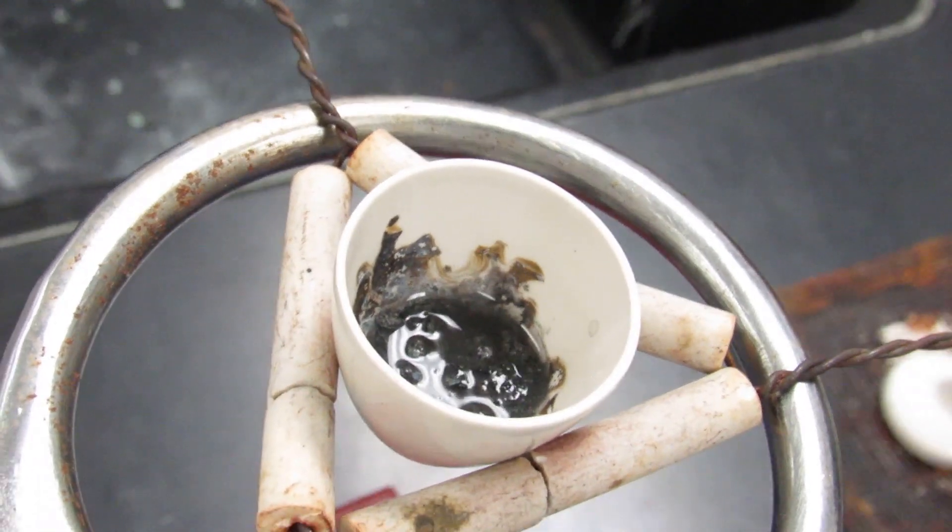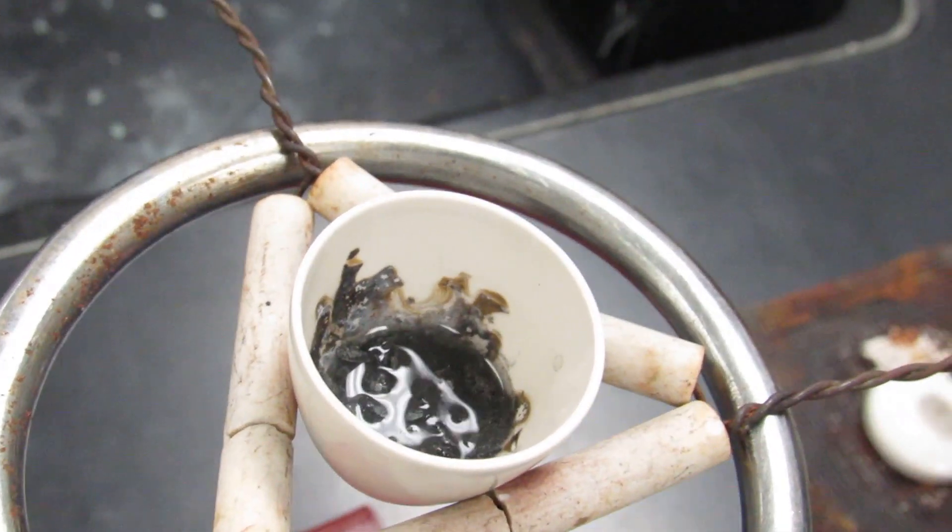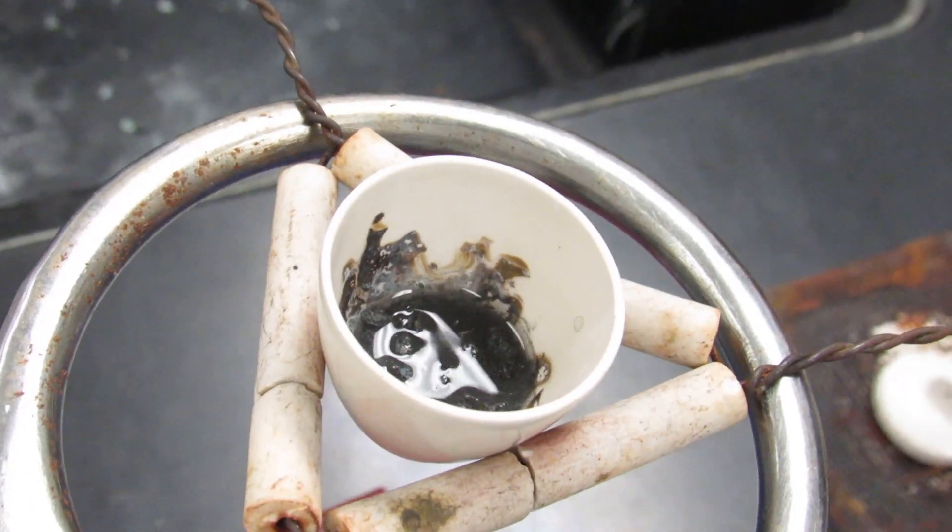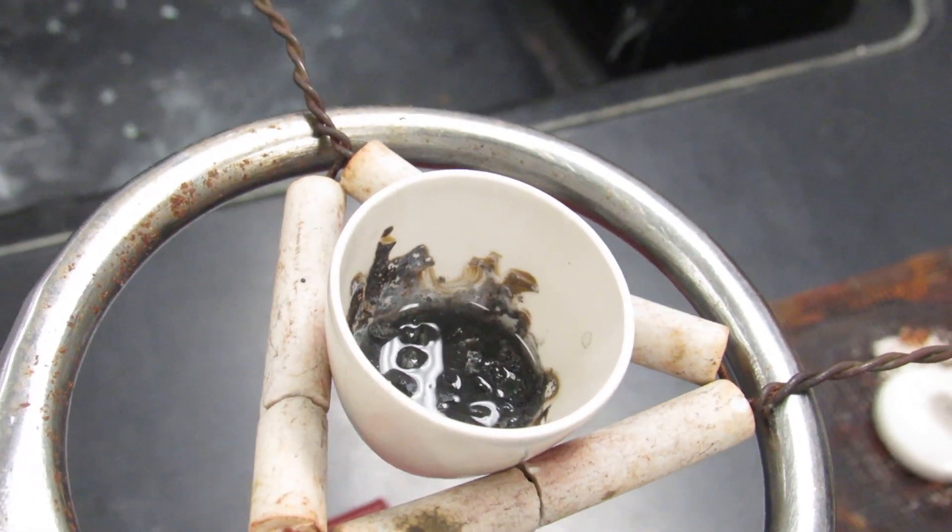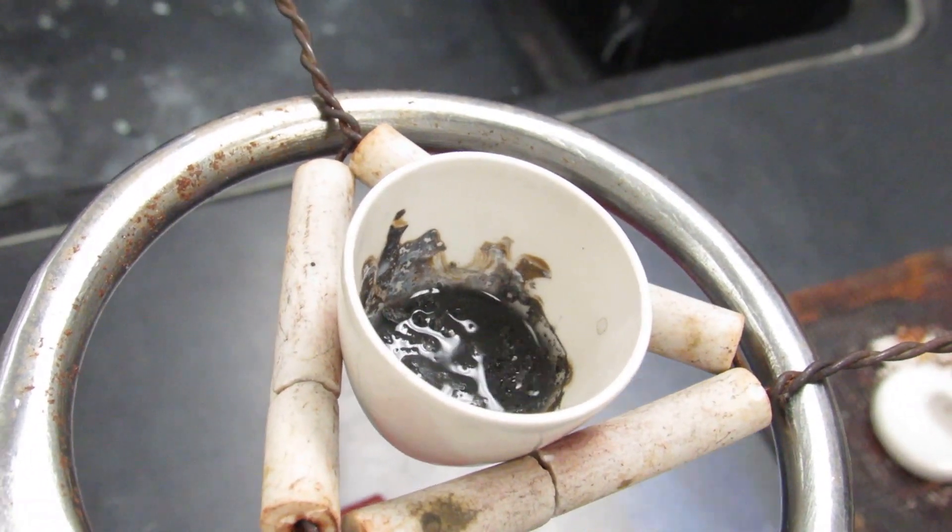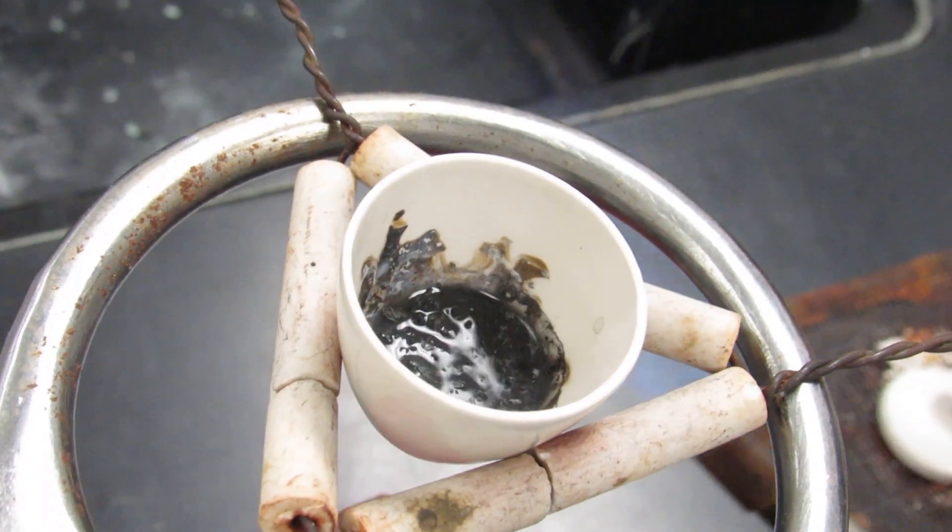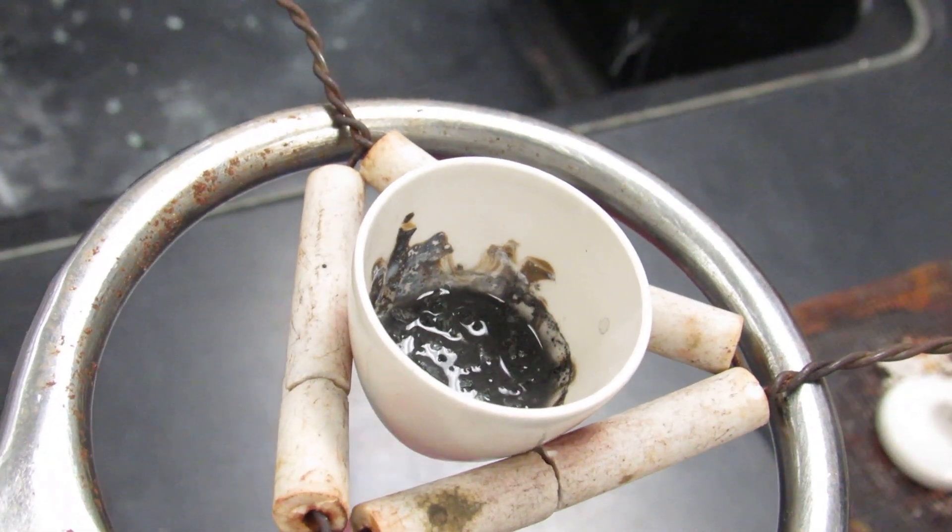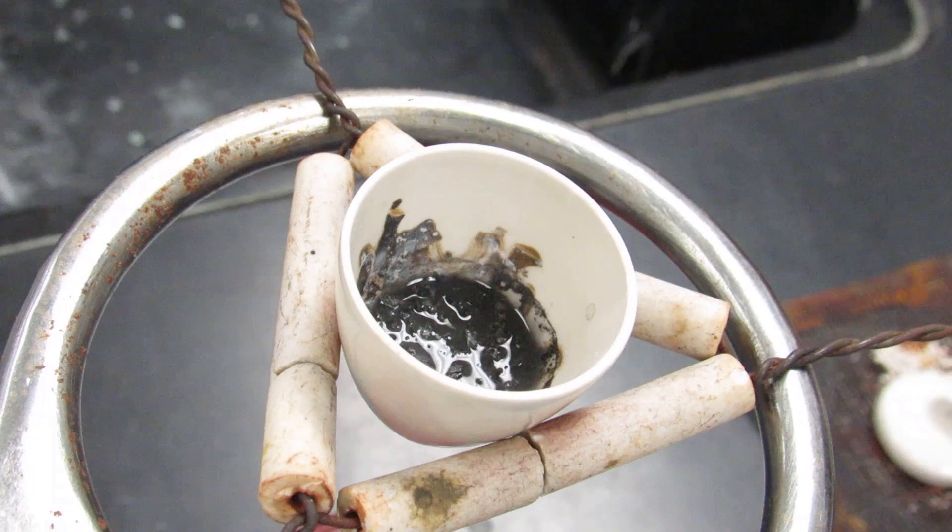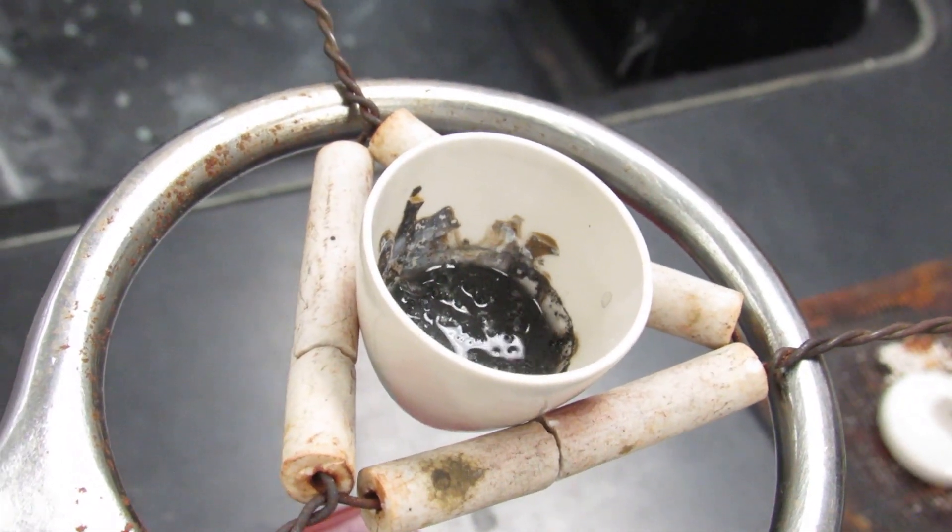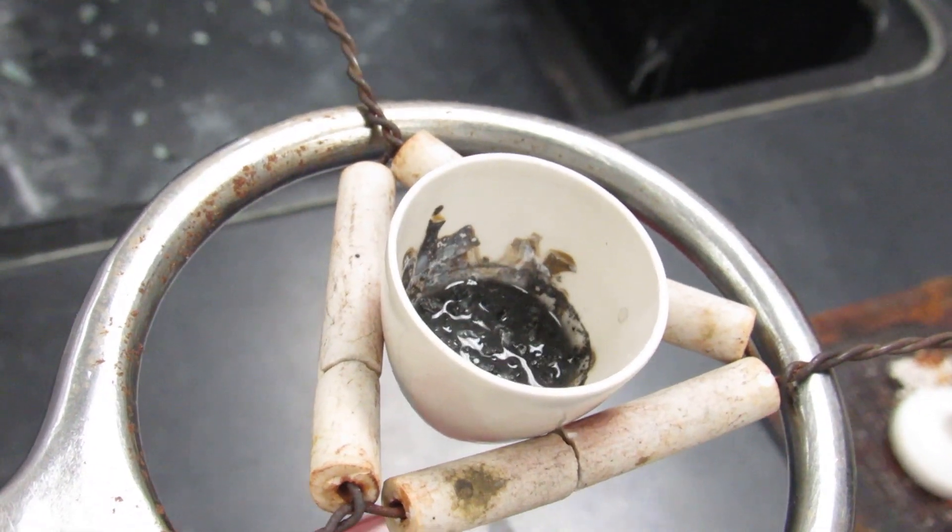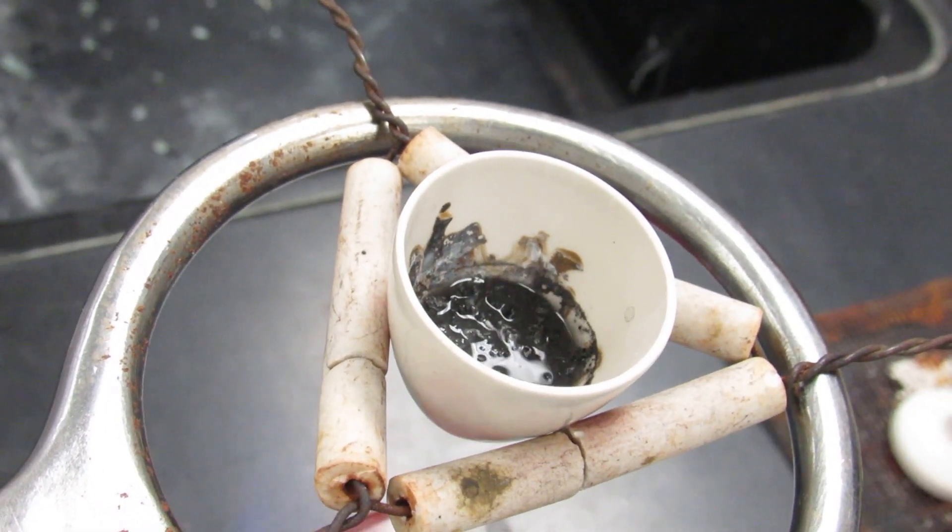Gently waving it underneath the crucible time and time again. Be very gentle. You see where it's getting a little simmery, little bubbles being formed. But less and less of the water is there. This does take about a solid five minutes to do right. So make sure you have sufficient time to do these steps.